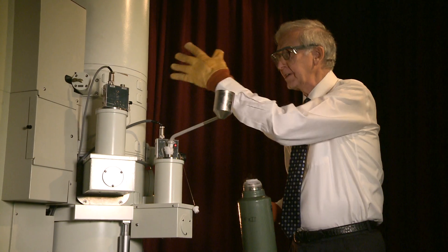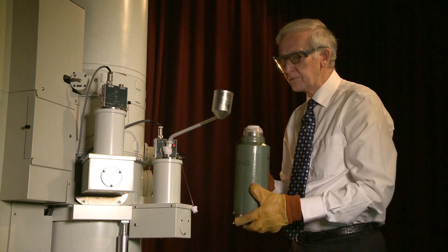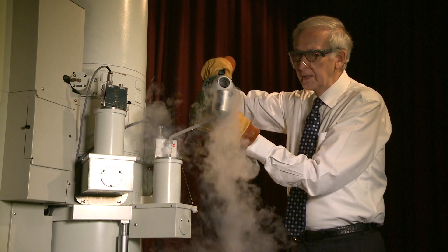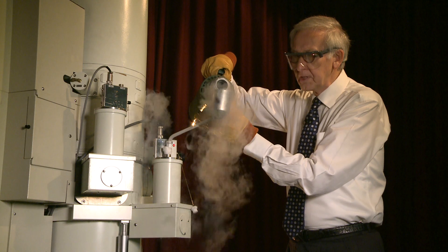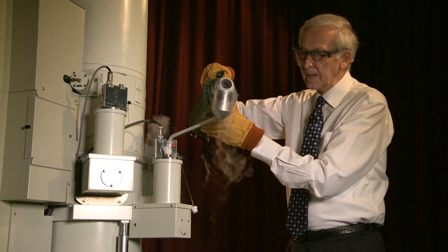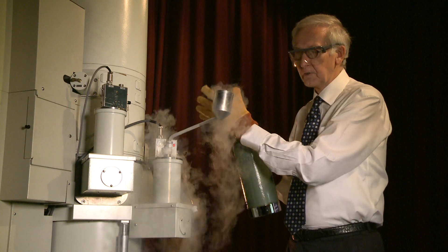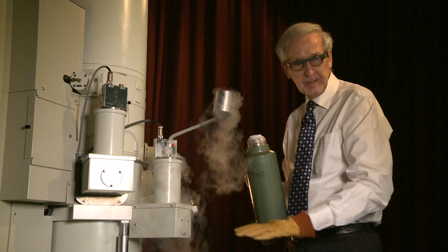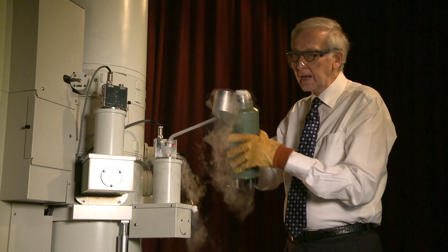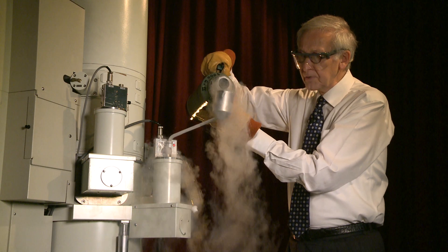This electron microscope has a vacuum in the column, otherwise the electrons would get scattered by air molecules. To improve the vacuum, we pour in liquid nitrogen, and around the specimen there's something called a cold finger, because it's very cold. The main problem with the vacuum is that, although it's very good, it contains a lot of water vapour. The water vapour condenses on the cold finger and not on the specimen, which is at room temperature. This improves the vacuum by a factor of ten, which improves the images you get.